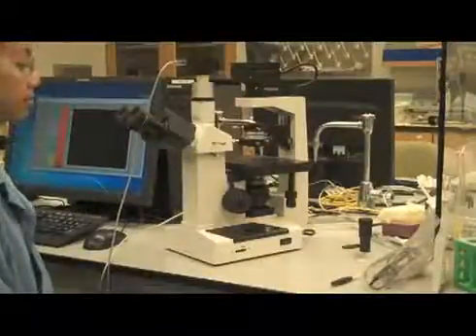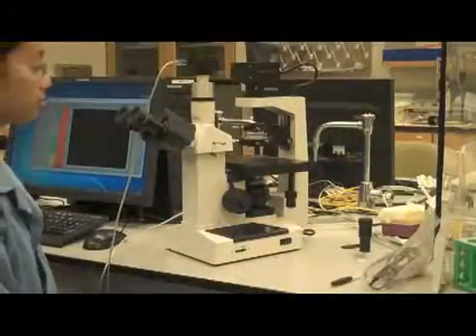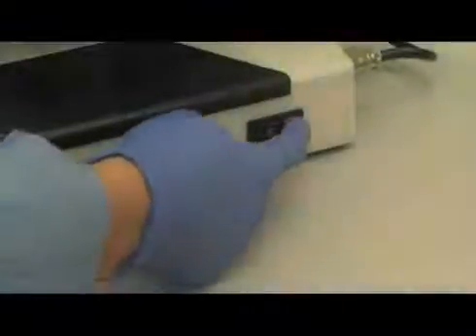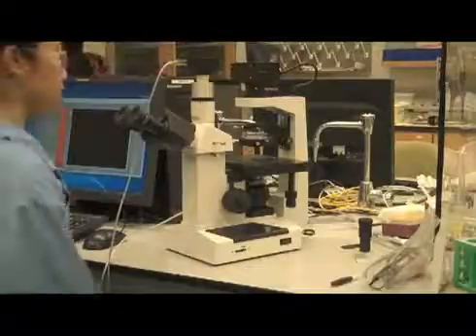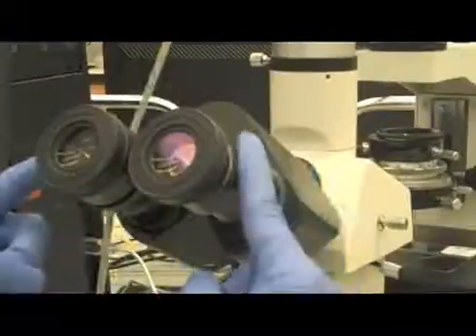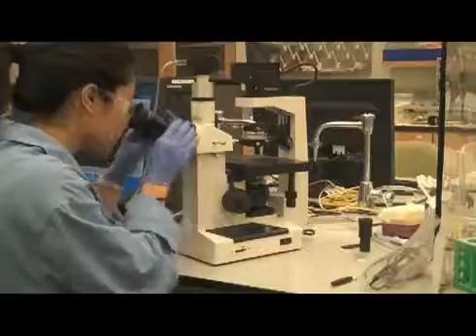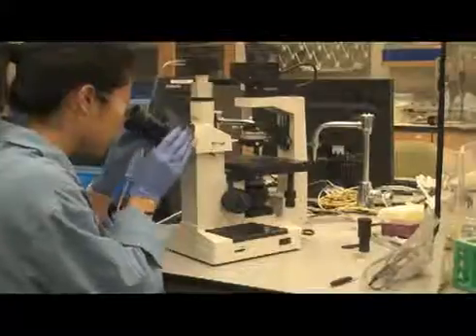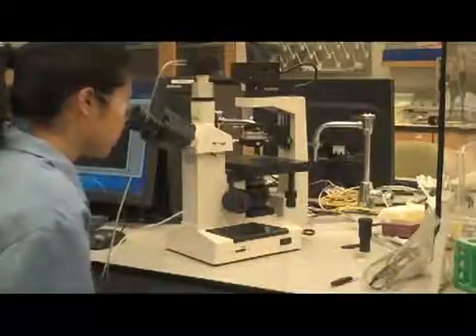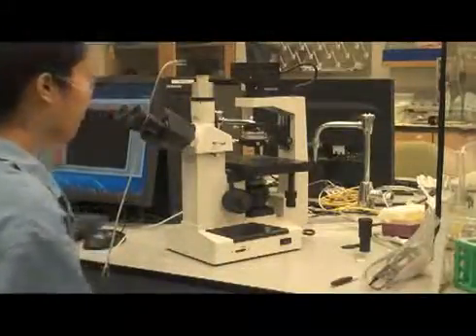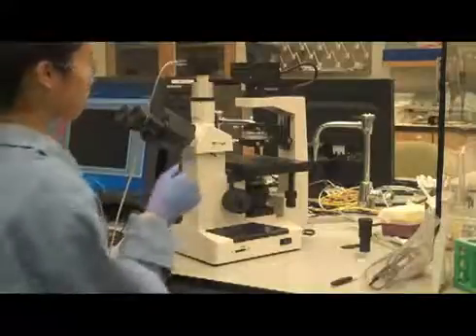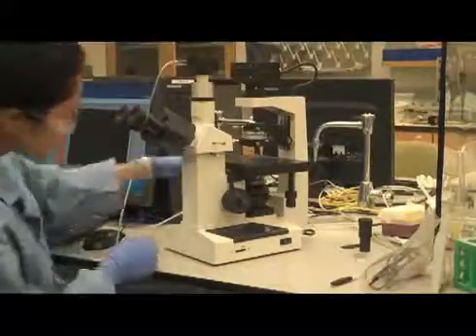Step 1: Push the power switch located on the side of the microscope near the base to turn it on. At the top of the microscope facing you, you should find two eyepieces. When using the scope, be sure to look into both eyepieces at the same time. By manually adjusting the base of the eyepieces, you can change the spacing to a comfortable fit for your view.